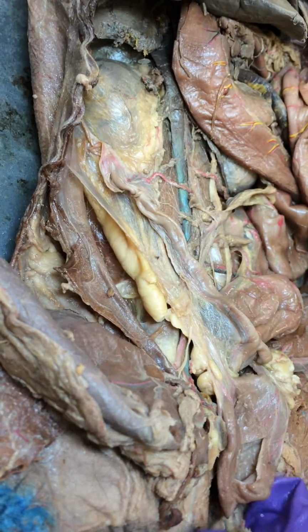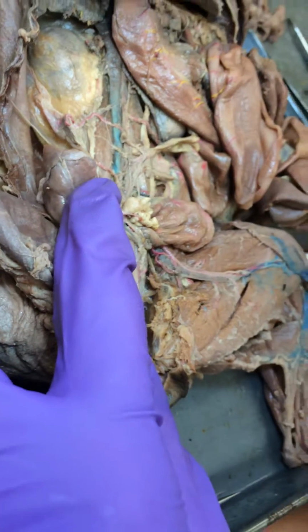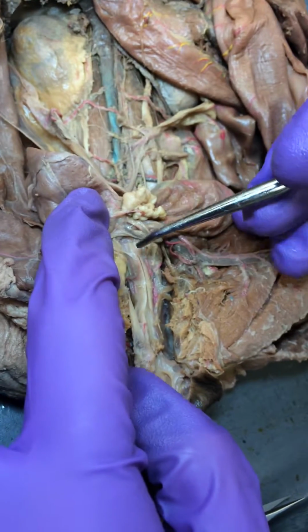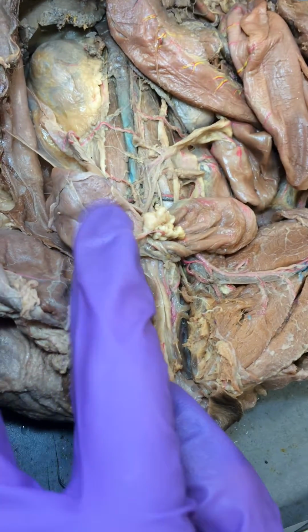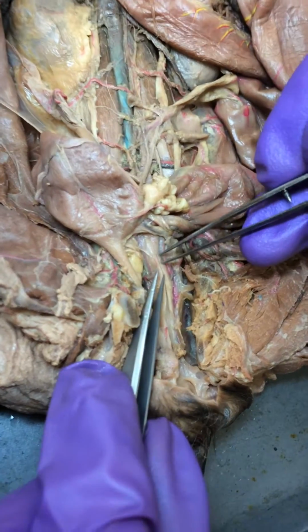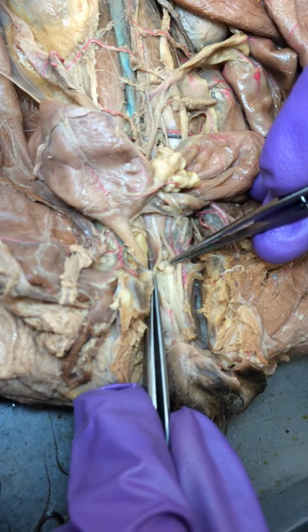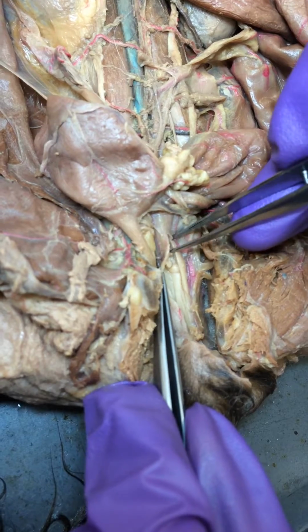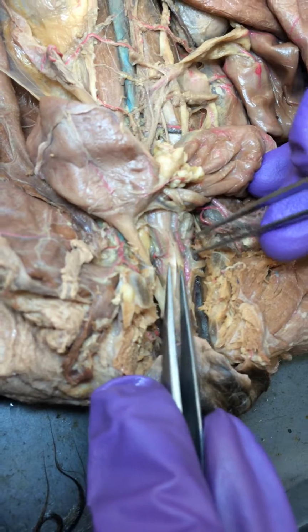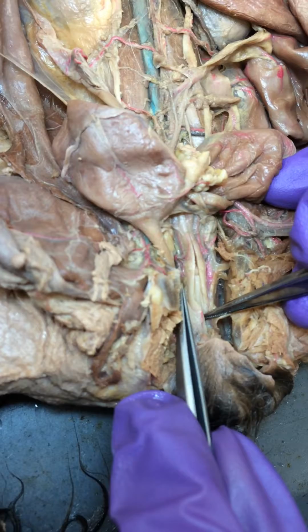Okay, and now we go into the uterus and vagina area right here. The uterus and the vagina are separated by the cervix. The cervix is a structure that goes all the way around the whole entire wall of the uterus and vagina. So whenever we cut it open, you can see the swellings of it right there and right there. And so if you were to close them up, it would create one little rounded structure. And so this is our cervix area, so that means that this is the uterus and this is the vagina.